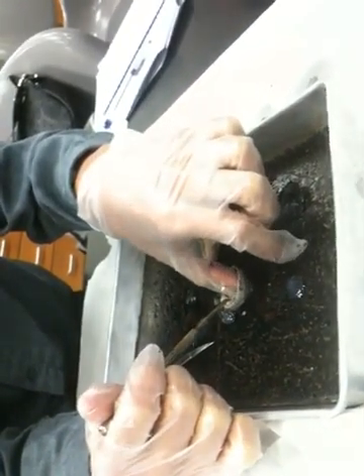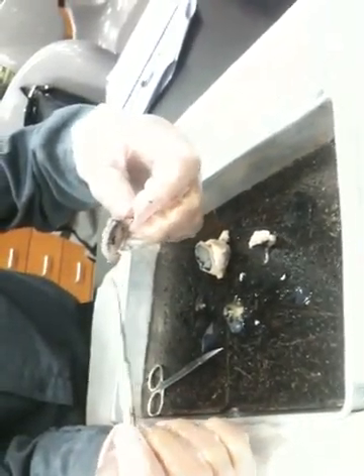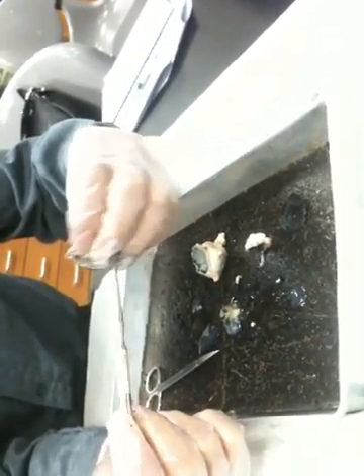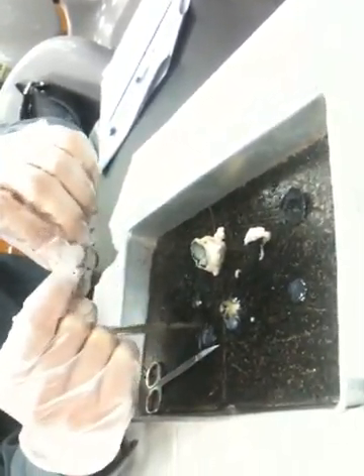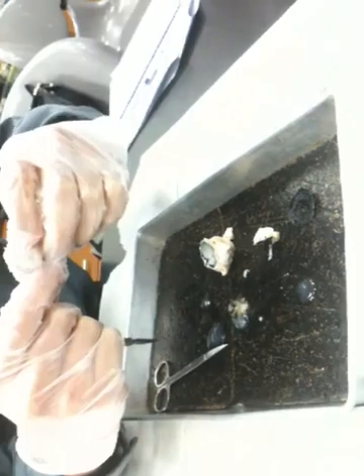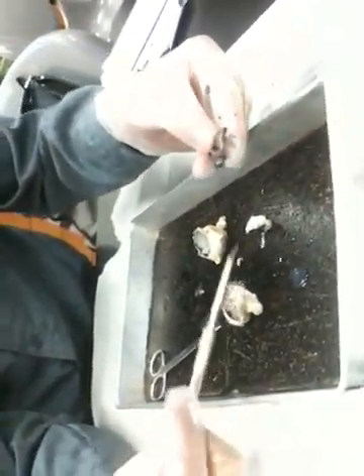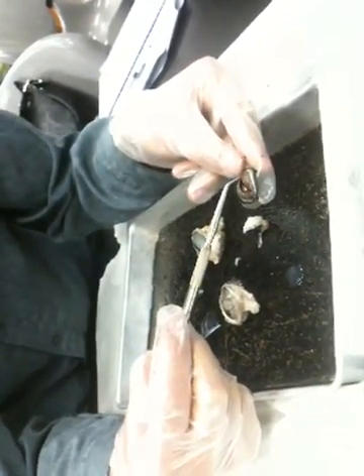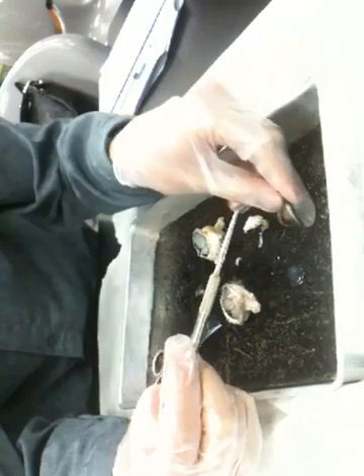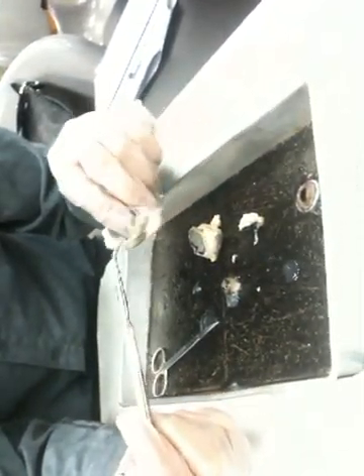To flip this over, I hope we're going to be able to see the ring of tissue that you would see from the front of the eye. There we go, which is the iris. And that is this band of material right around here that encloses the opening of the pupil. It has a layer of circular muscle and a layer of radial muscle so that the opening of the pupil can be either expanded or constricted by contraction of one of those two muscle layers.